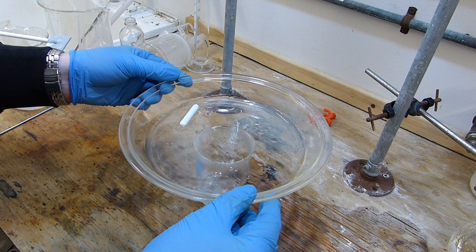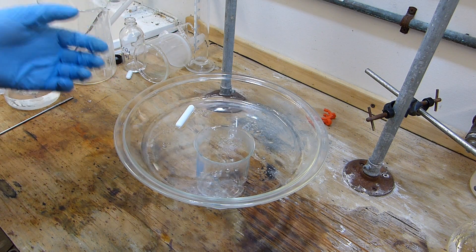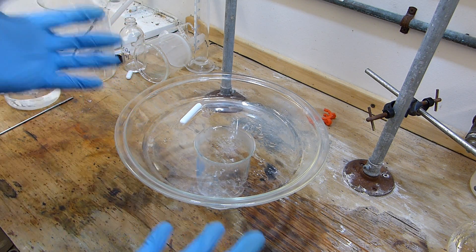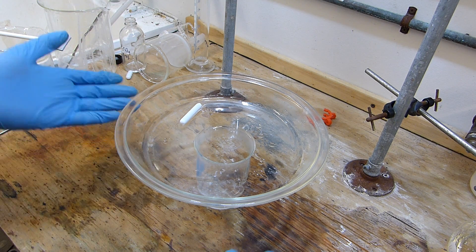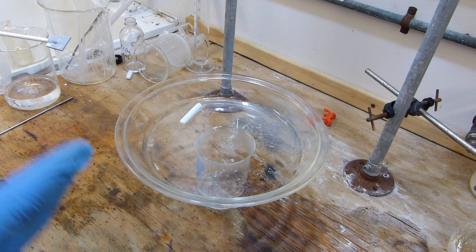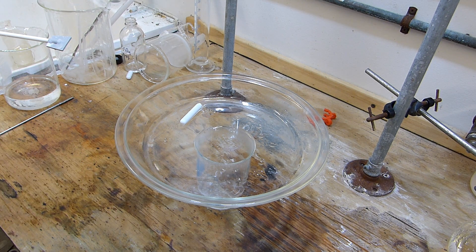All right, so we have the molten product here. Unfortunately the previous clip didn't capture, but I did take it off the water bath after it had been sitting for about 10 minutes. Now I've got it up on this beaker which is just supporting it as it cools and gets air underneath it. I'm going to leave this here for a little while and eventually it will cool and solidify, and we can scrape it up and put it in a bottle.